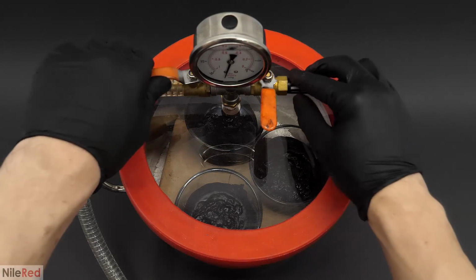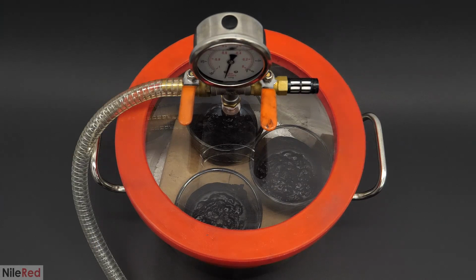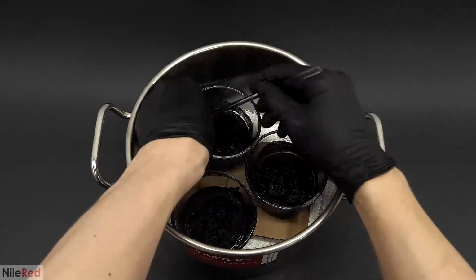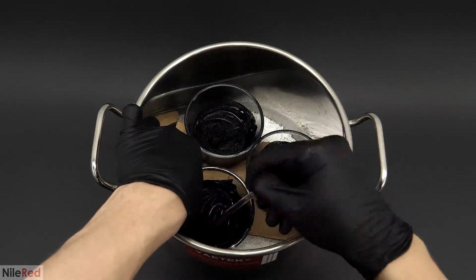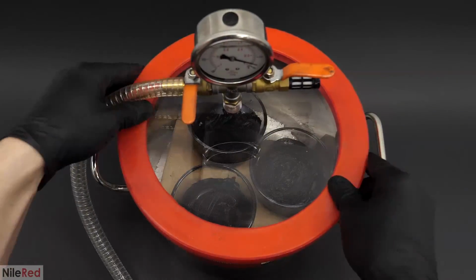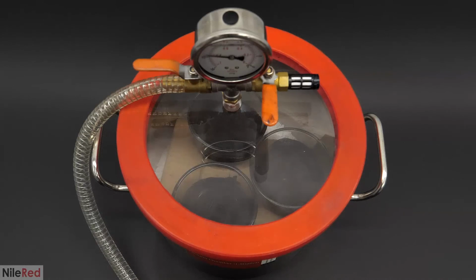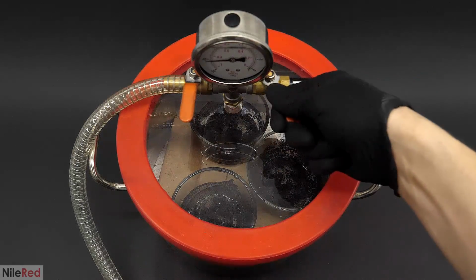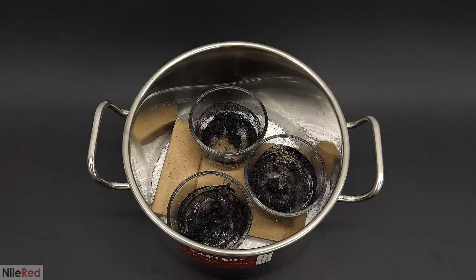After pumping on it like this for about 5 minutes, it looked like most of the alcohol was gone, and I closed the valve again. A few hours later, I repressurized the chamber, opened it up, and mixed things around. This wasn't really necessary to do, but I did find that it does help speed things up a bit. After doing that though, I put the lid back on, pulled another vacuum, and I left it overnight. Any alcohol or water that still remained just slowly evaporated, and it was continually picked up by the calcium chloride at the bottom. By the next morning it was ready, so I opened it up and I pulled everything out.